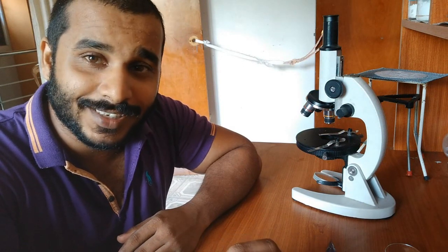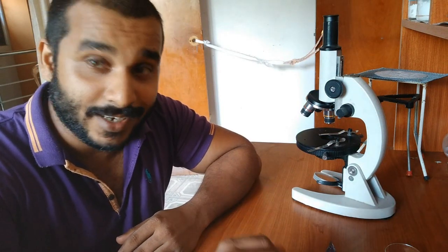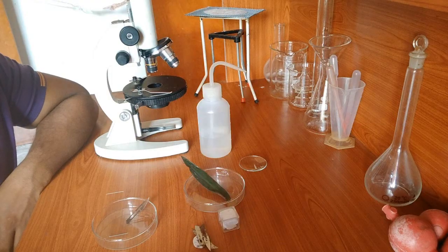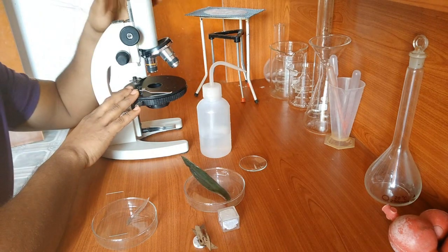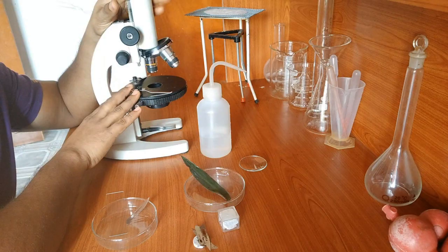For the preparation of the raw specimen, so what we're going to do here is we are going to need some stuff. So I'll collect them and come right back. For the preparation for that, we need the structure. You know this what it is. This is the light microscope. So it's a compound light microscope.